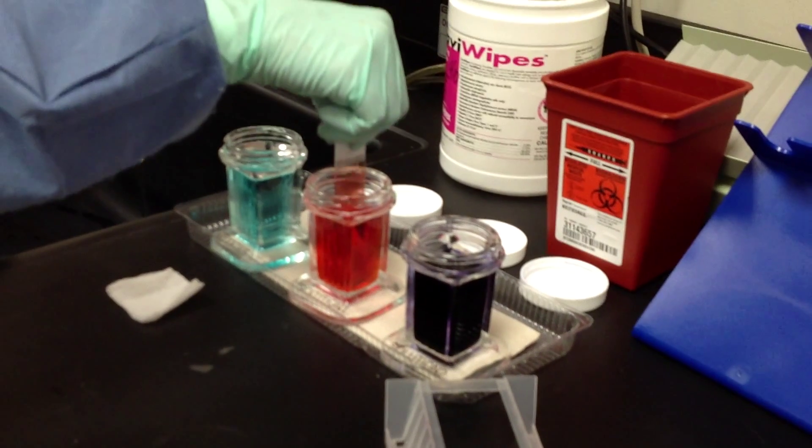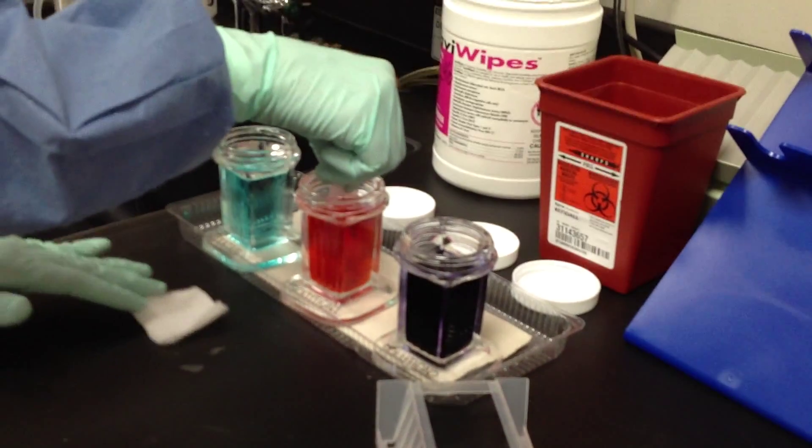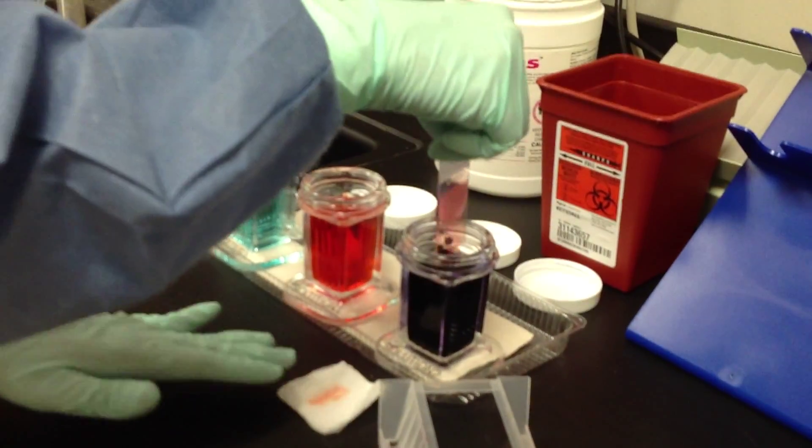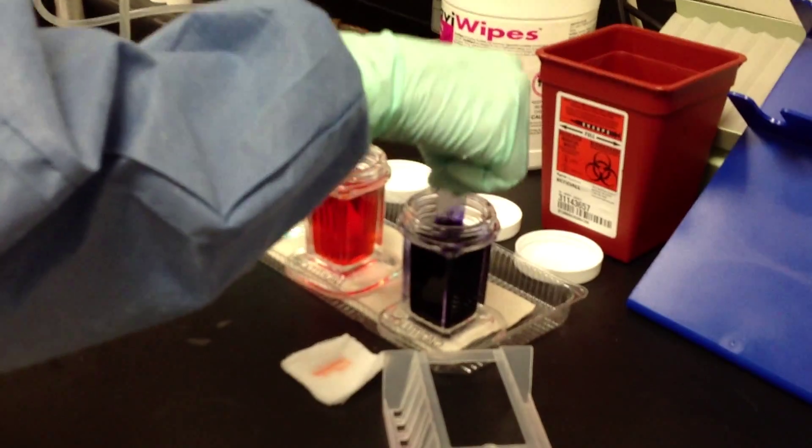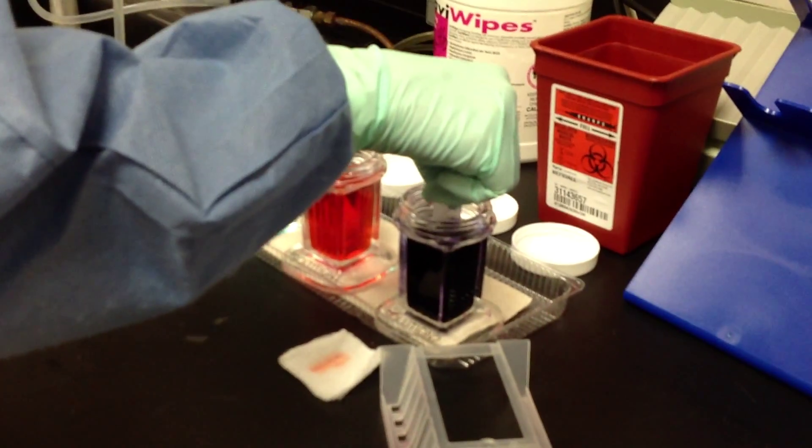Once she has the fifth dip, then she will remove the slide, touch the gauze gently to blot it, and immediately go into the second staining solution for five one-second dips.